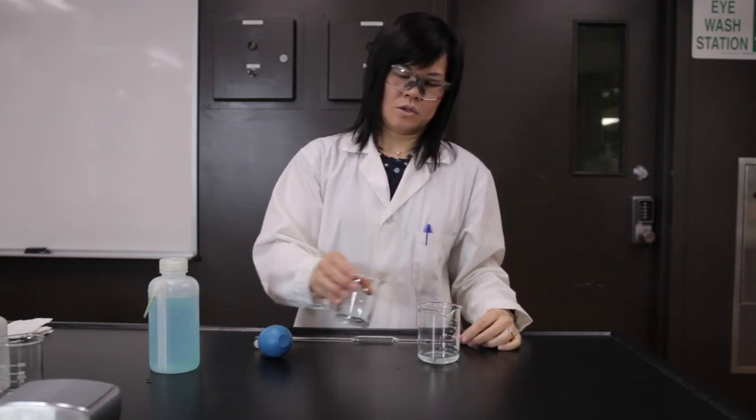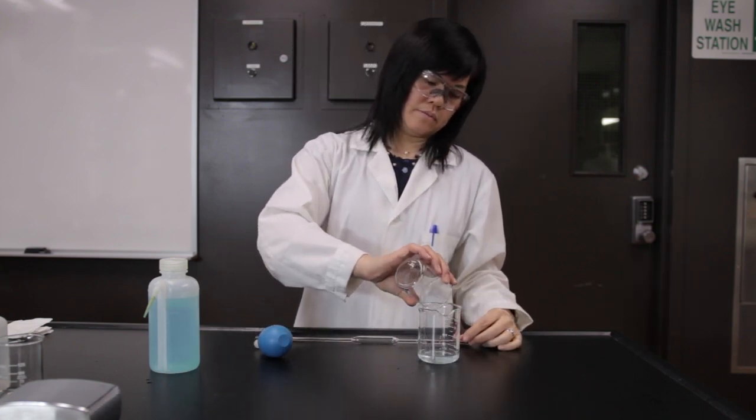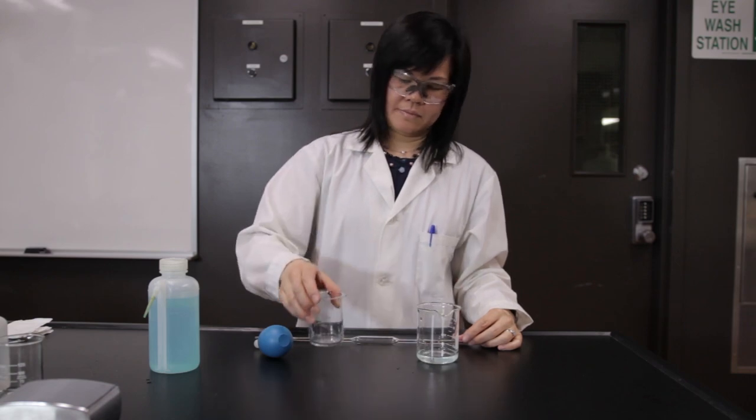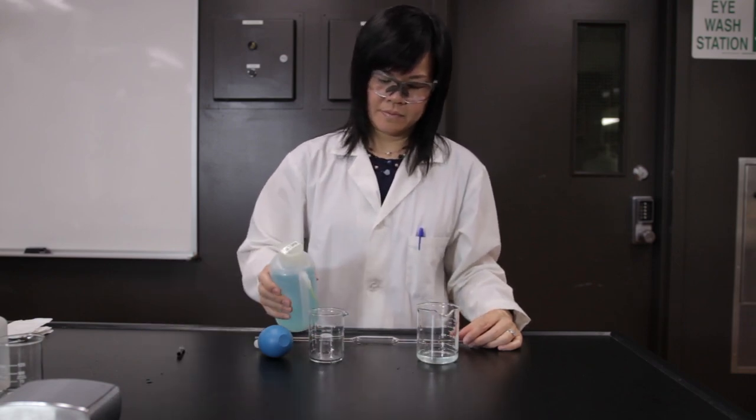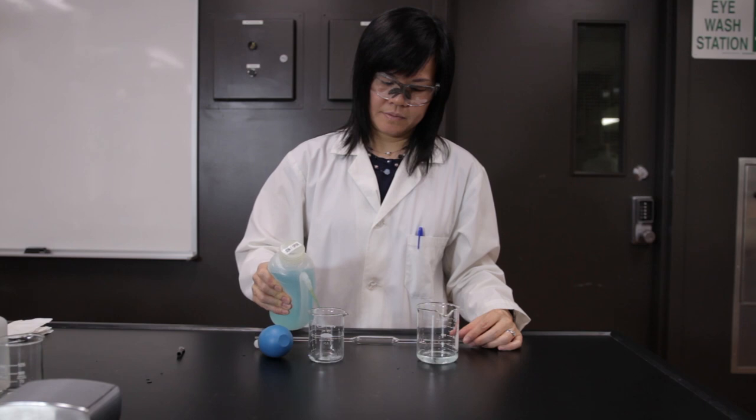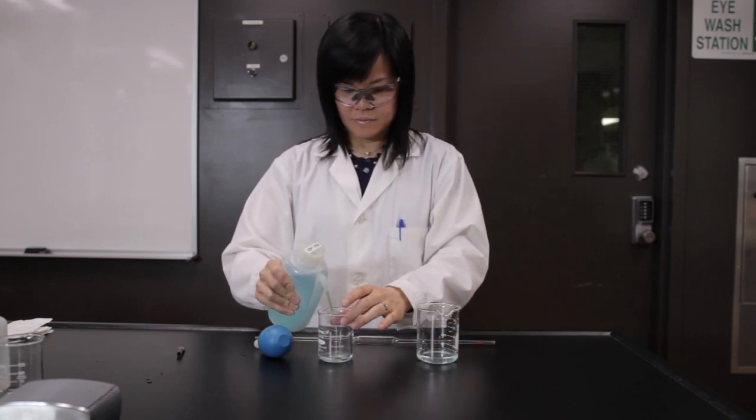Discard the solution as it is considered contaminated. Refill the beaker with approximately 20 milliliters of the unknown copper ion solution.